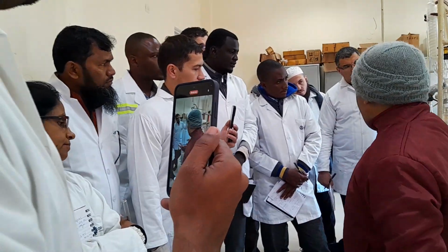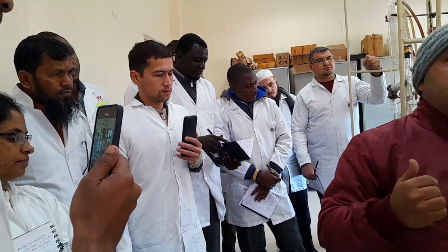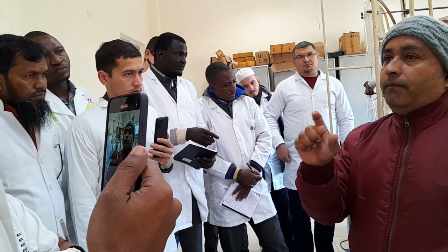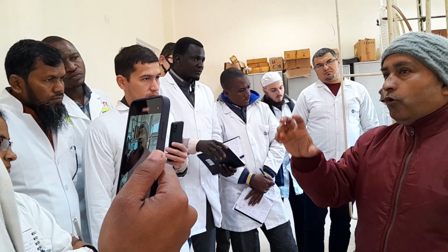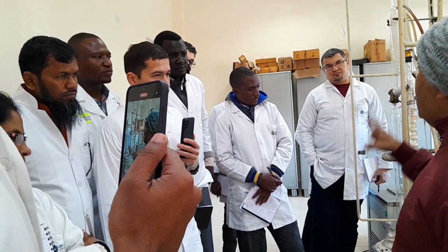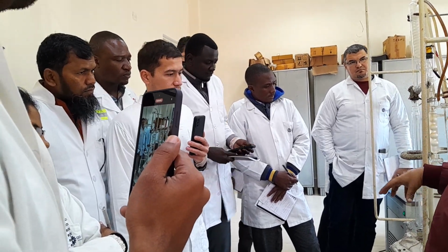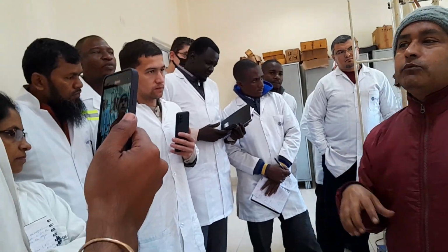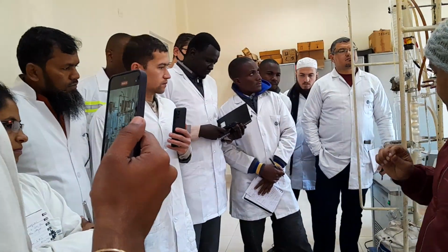Okay, so whenever you are doing fractional distillation, there is a particular condition: how much minimum sample you will have to distill and how much maximum sample you will have to distill. For that, you will have to mention the height of the column and the height of the condenser, fraction cutter and receiver. So my condition has been optimized for a minimum of 1.5 liters of crude oil and a maximum of 20 liters of sample. For that I have a column for fractional distillation.